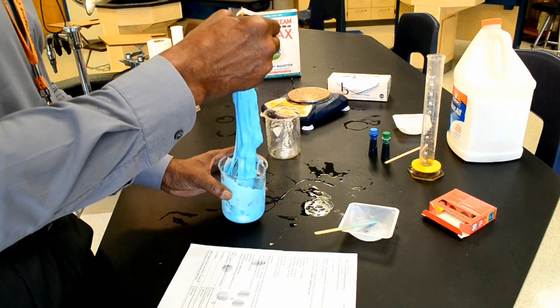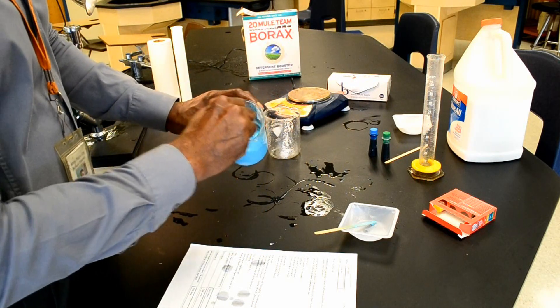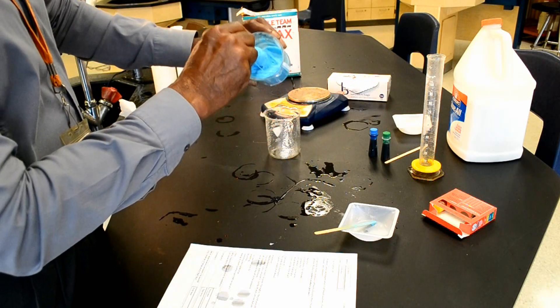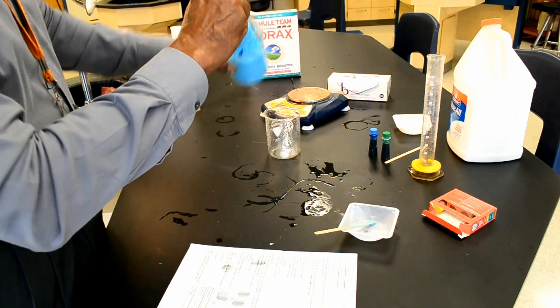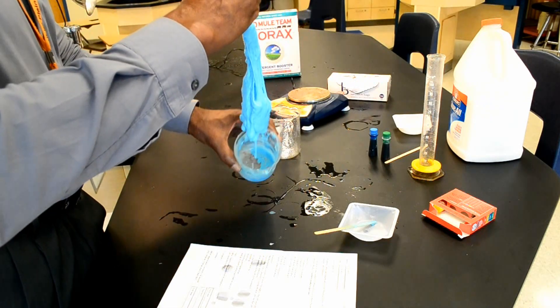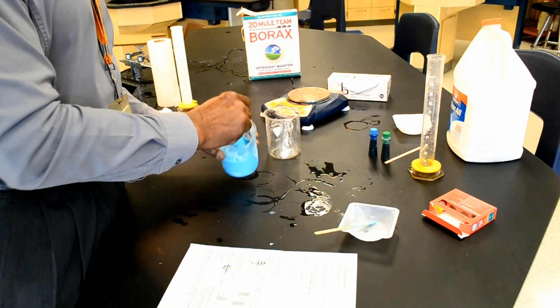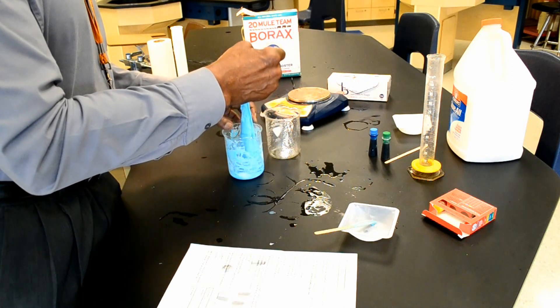You can see that's quite a bit of flubber right there. Now I've almost used all of it. I have just a little bit of liquid left in the beaker, and I have a bunch of flubber here that I'm now going to take out with my hand.